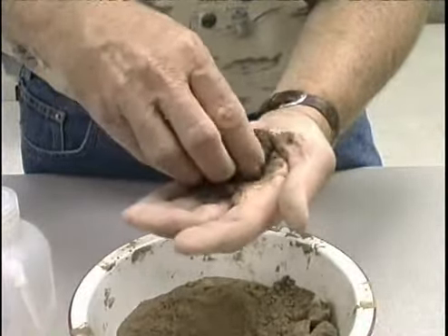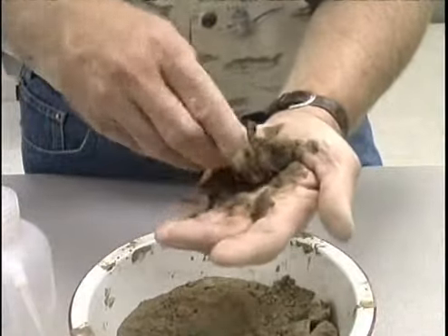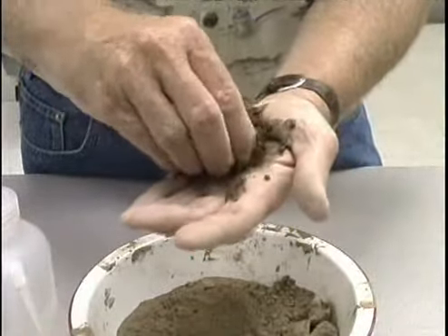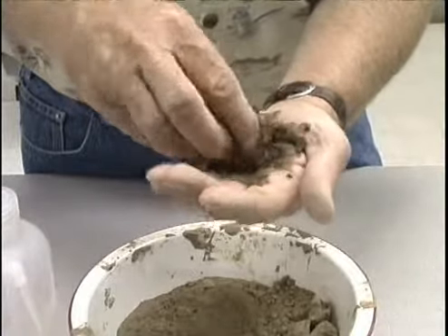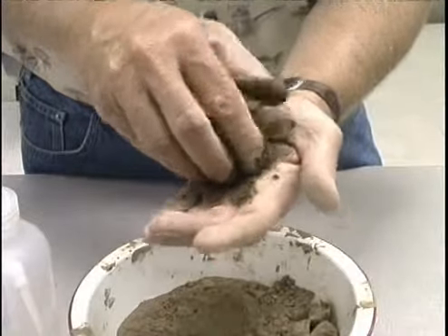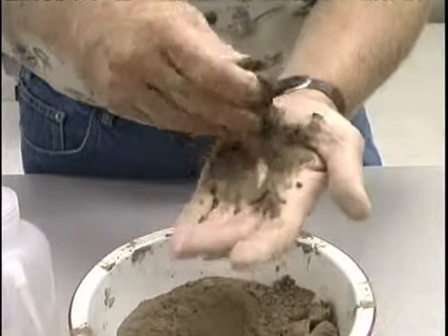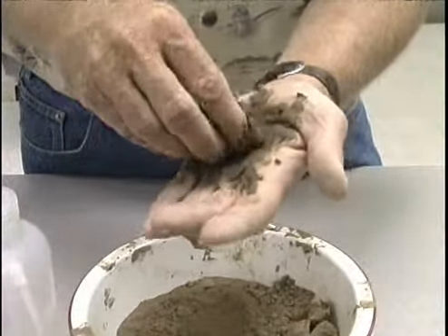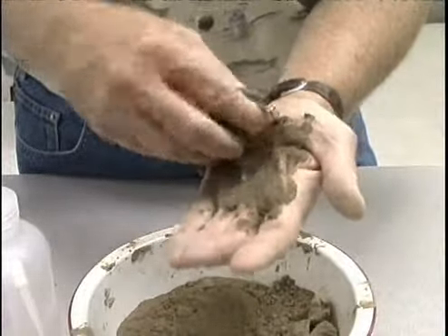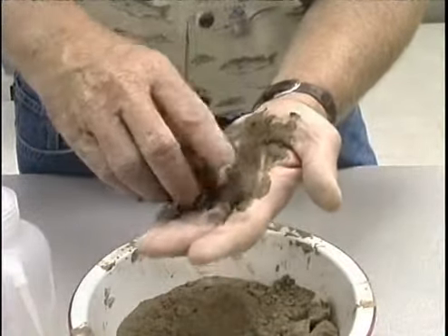This soil will feel much more moldable. It will also be much stickier. You notice how it's sticking to my fingers and the palm of my hand. The aggregates that are in there have become moistened now, and what I'm doing is I'm molding those into part of my ball. Notice how it stains my hand, whereas the other one did not, and that's also indicative of a much higher clay content.